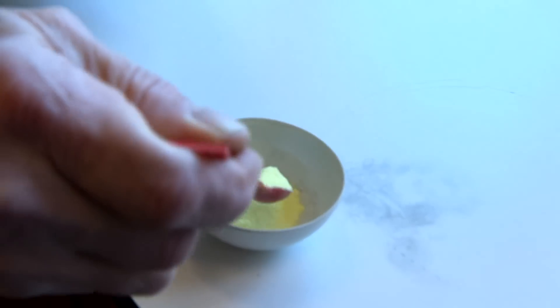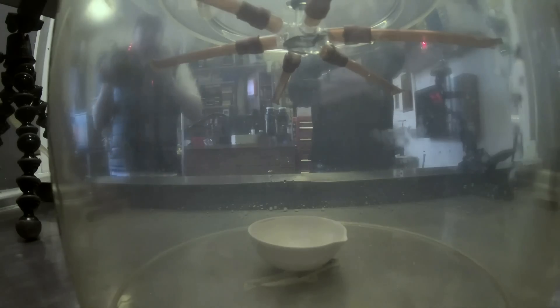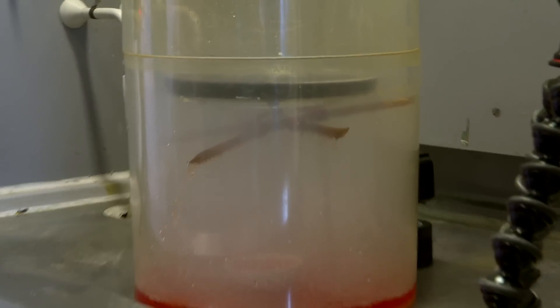It burnt well. In fact, it caused fog inside the container. That's rather interesting because when people burnt coal with sulphur in it, we used to get terrible smogs — people couldn't see their feet when they were bicycling because the smog was so thick. The experiment then worked really nicely. You could see the water going down, forming raindrops, and as the drops fell, they went from blue to red.